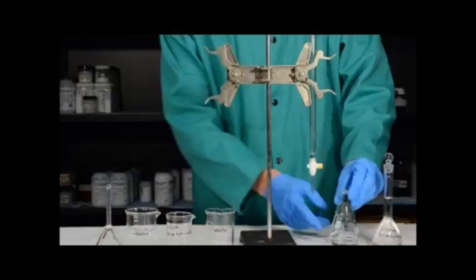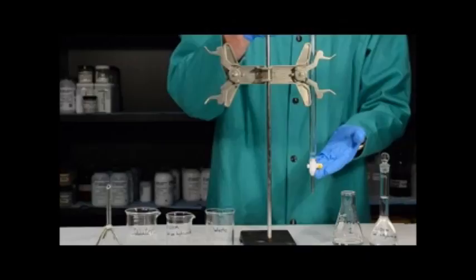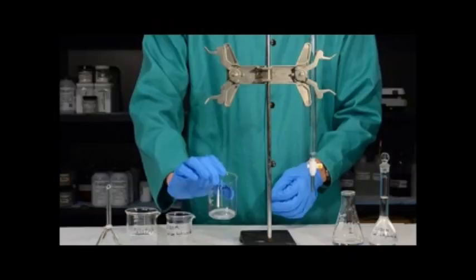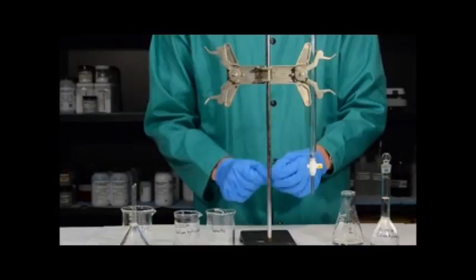Now that we have our acid in the Erlenmeyer flask with indicator added, we need to use a burette in order to do a titration. You're going to do this over four trials, but here I'm just going to demonstrate with one. A burette allows us to measure how much sodium hydroxide is used in the reaction. Before we can use the burette, we need to clean it — you're going to need a beaker for waste, a beaker for your 0.1 molar sodium hydroxide, a beaker of water, the burette itself, and a funnel.